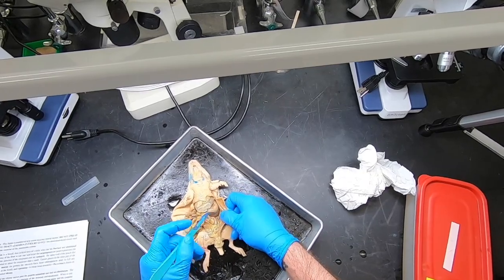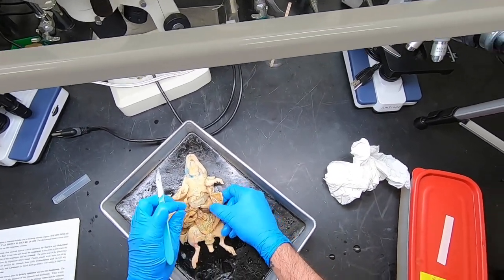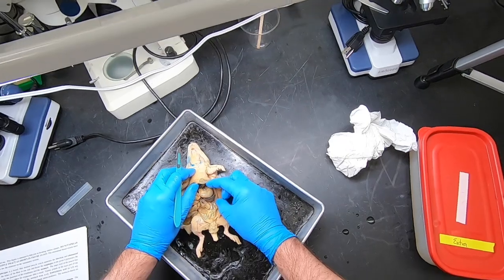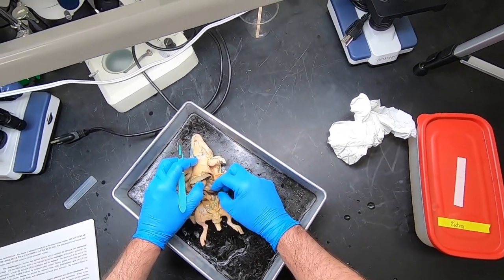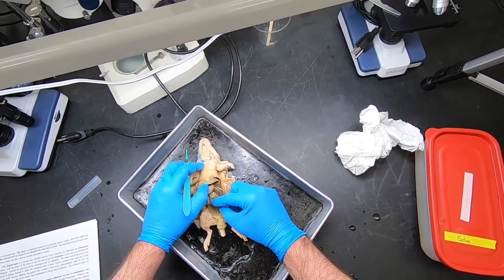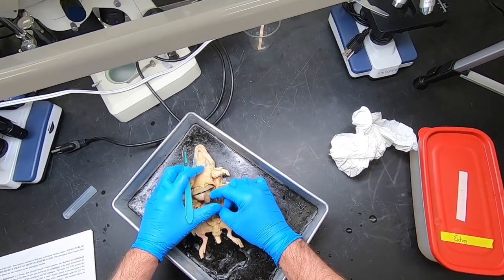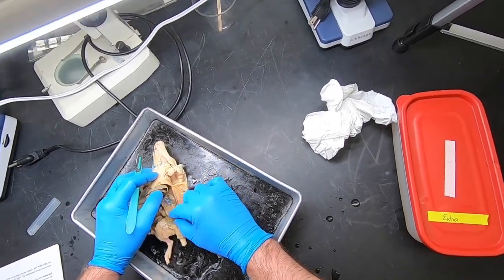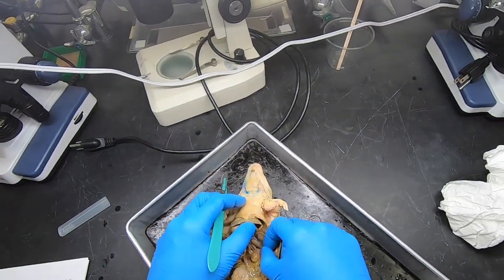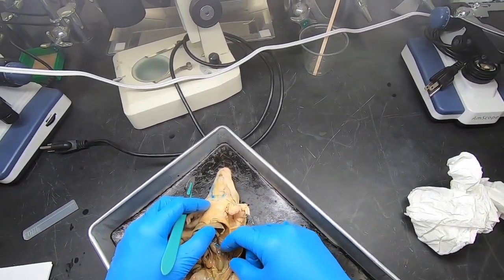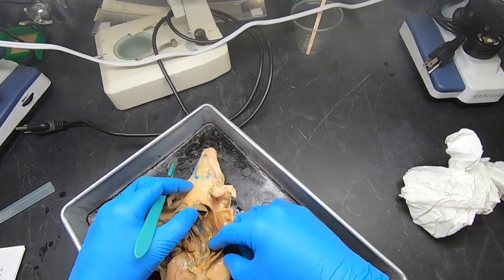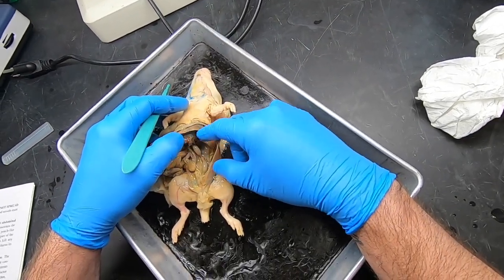Now what else do we need to know? We need to know about the liver. The liver is up here. This structure here which kind of looks like liver but is not liver is the spleen. Underneath there we should find a gland that has the consistency of chewed-up chewing gum, which is the pancreas.